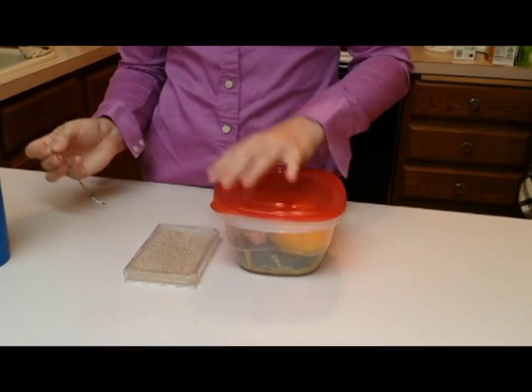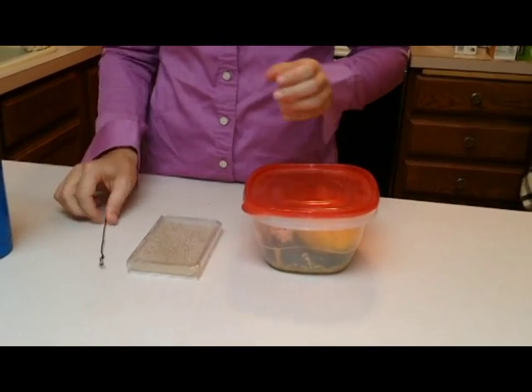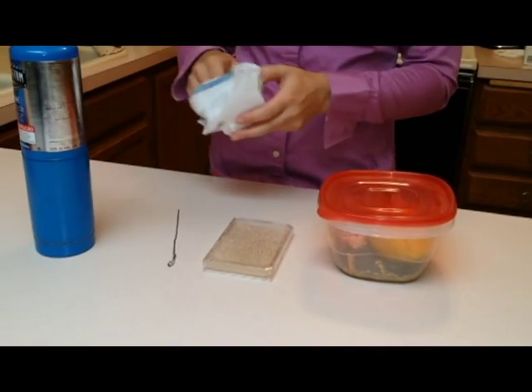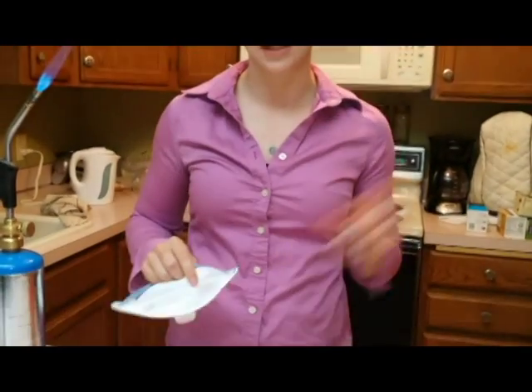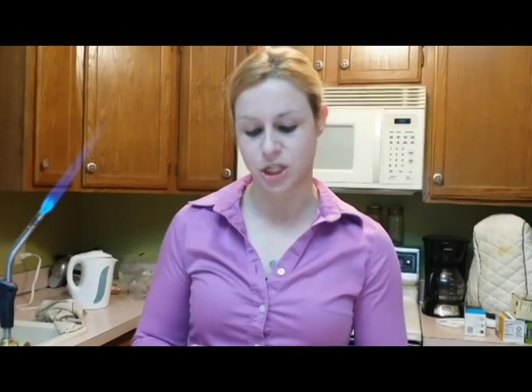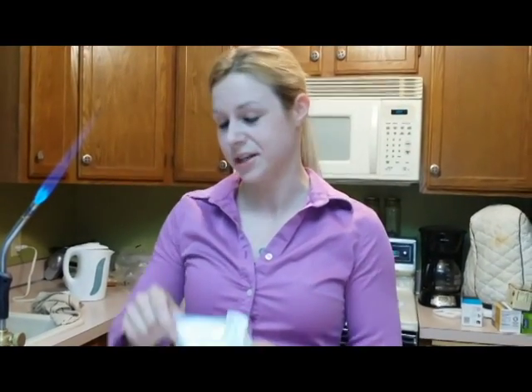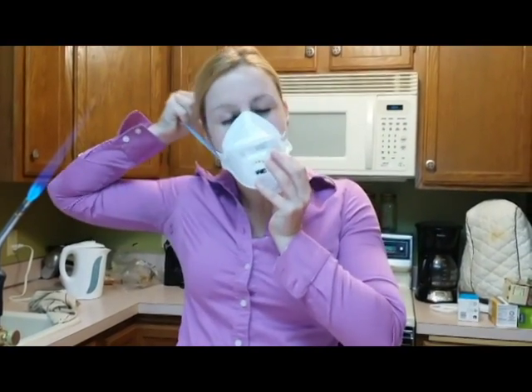Now I'm going to put this down. It's not sterile anymore. I do need to put on my mask because this is some sort of spent Penicillium species, which means the spores are not great to inhale. I'm going to do that. Okay.